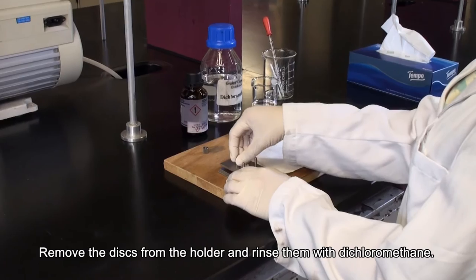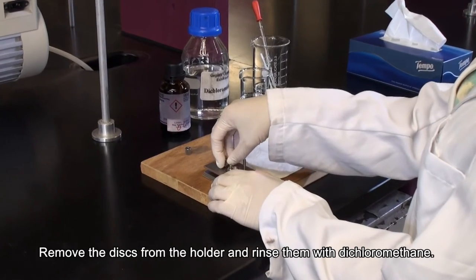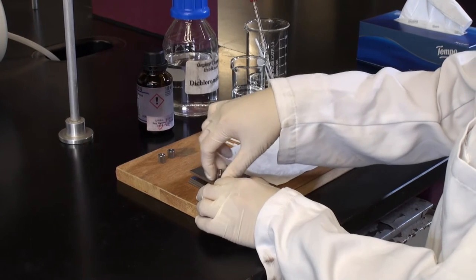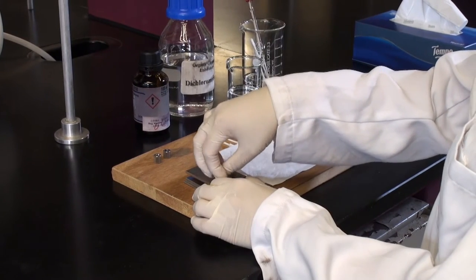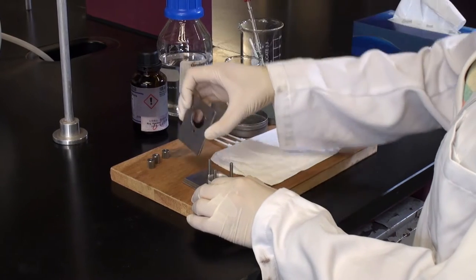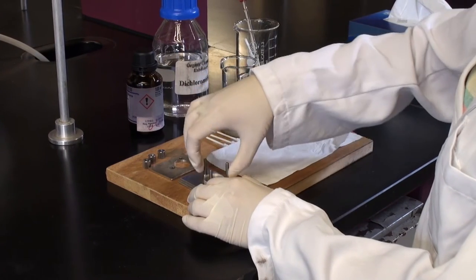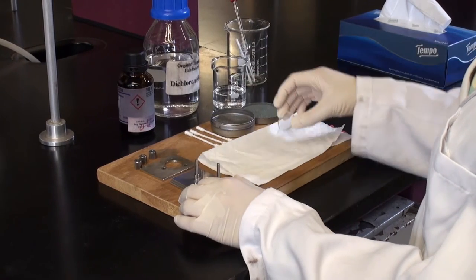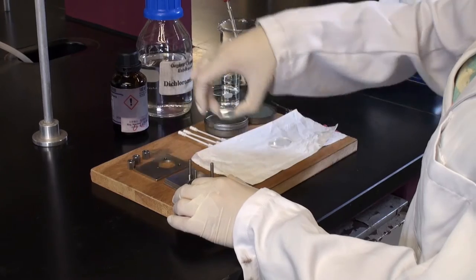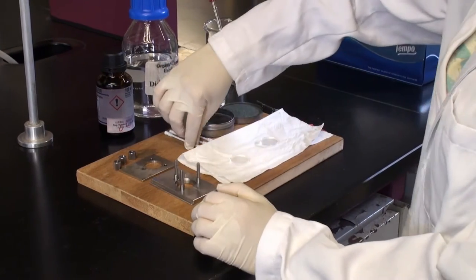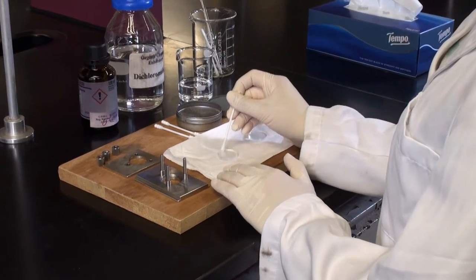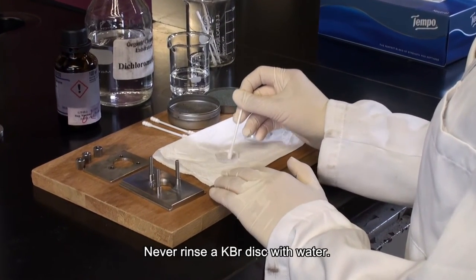Remove the disks from the holder and rinse them with dichloromethane. Never rinse a KBr disc with water.